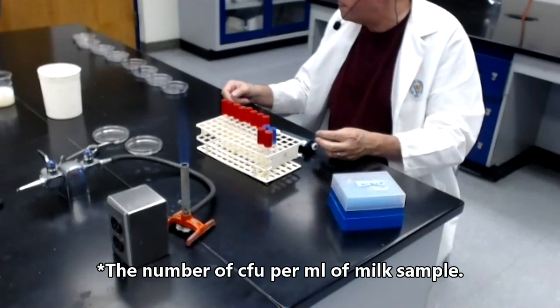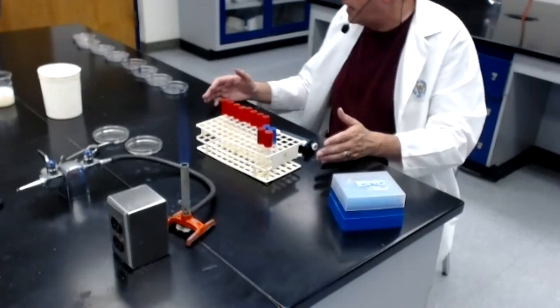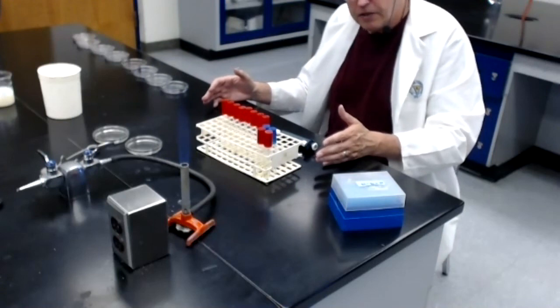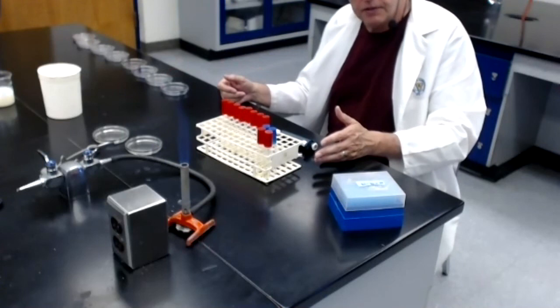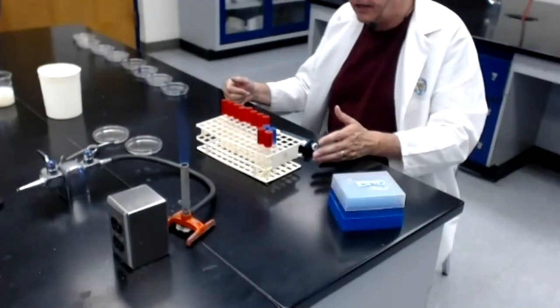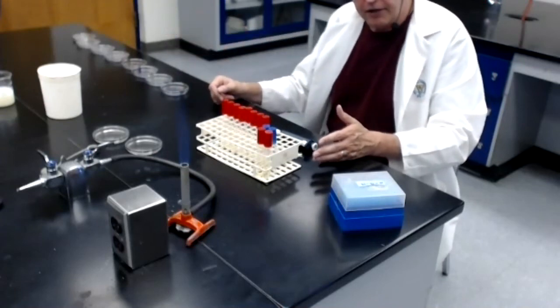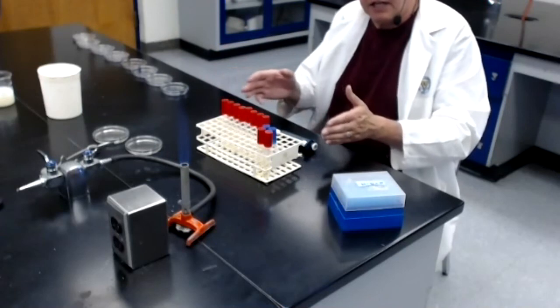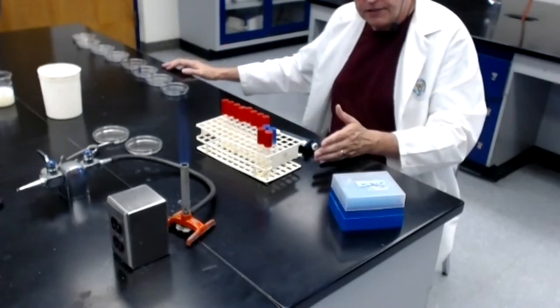Now, something I did here, I did this for the purpose of the video, is I did only one plate for each of the dilutions. What I'm probably going to do off camera is I'm going to get another 10 empty plates and 10 more tubes of melted agar, and I'm going to go back to these 10 dilutions and make another complete set of plates.